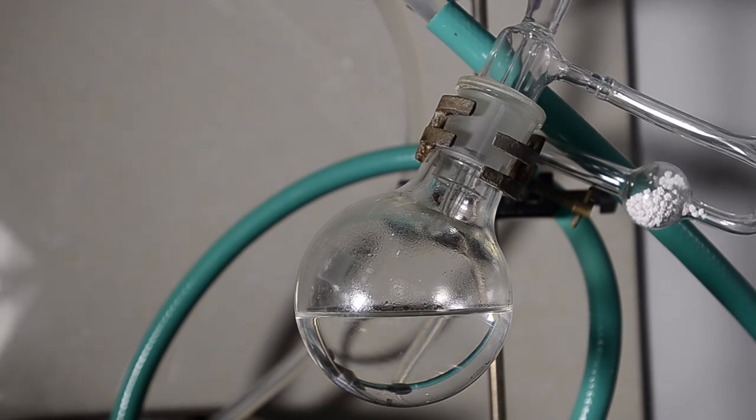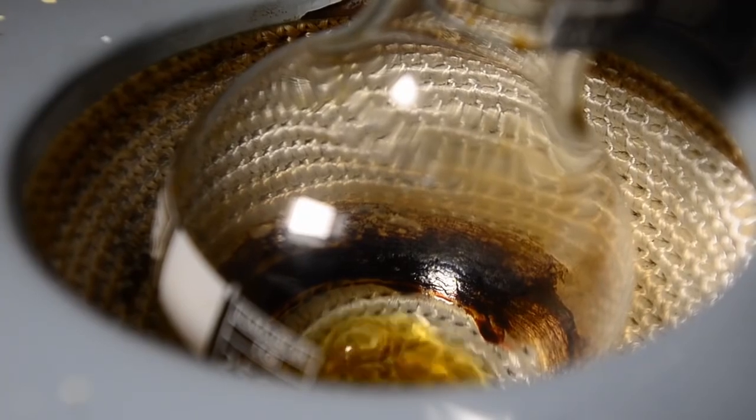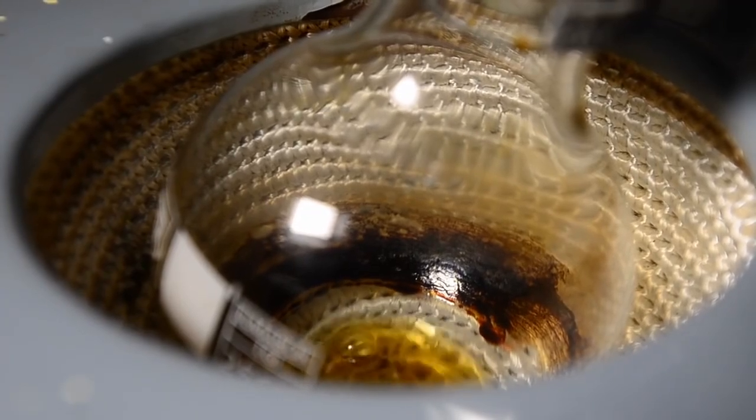Complete distillation took around two and a half hours in total and the boiling point was very consistent throughout. At the end the boiling flask contained some tar-like residue.